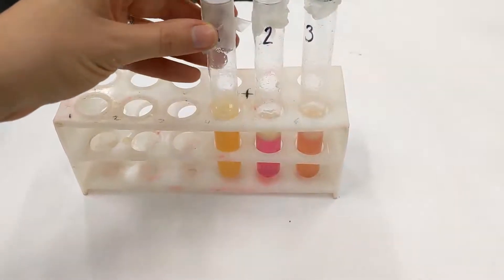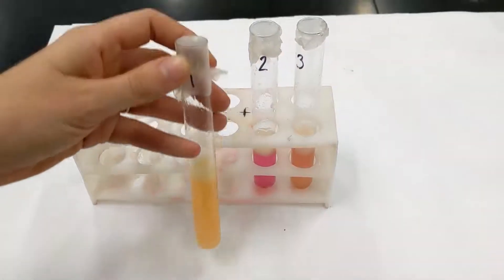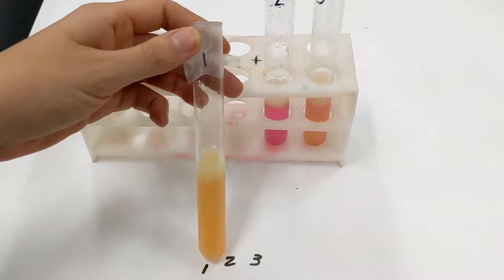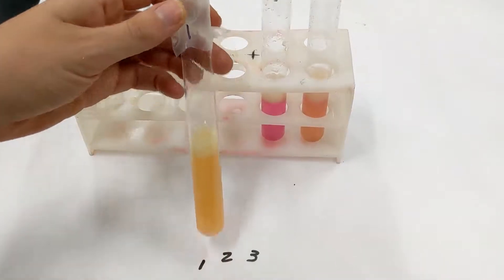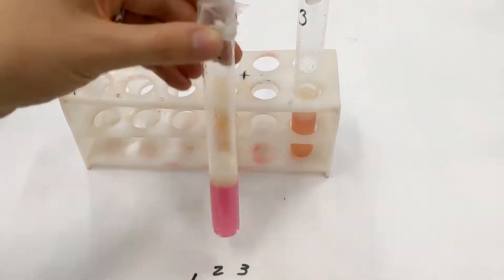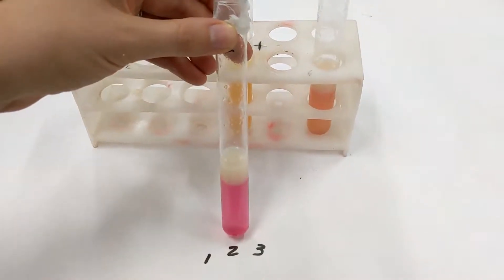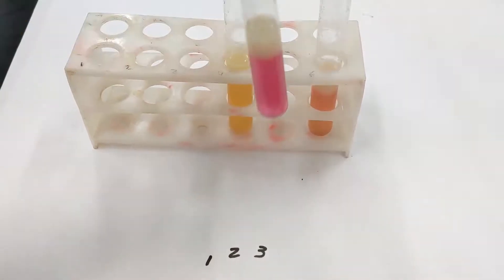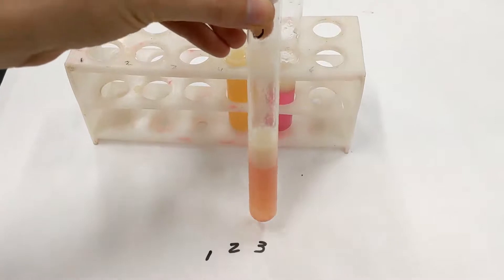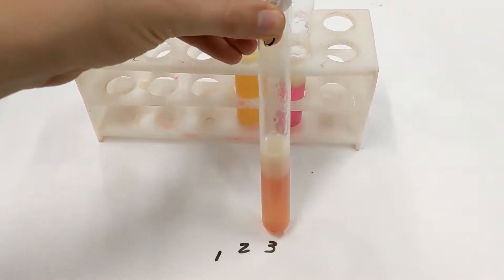Here are the results from our lipid digestion. Here is tube one, here is tube two, here is tube three.